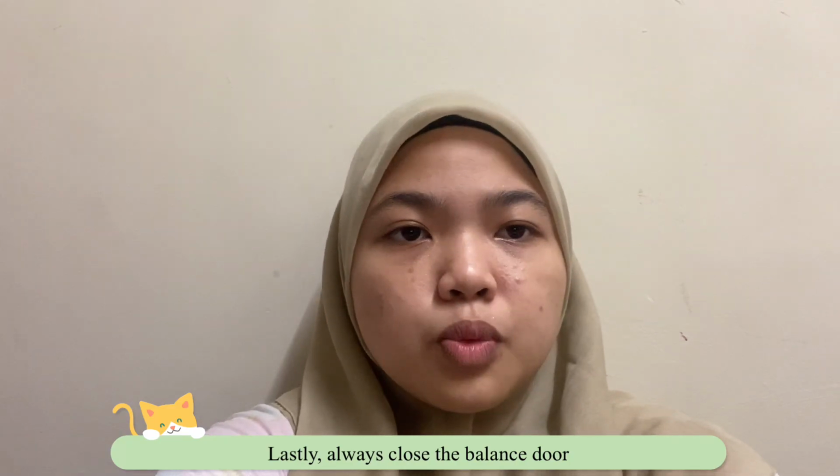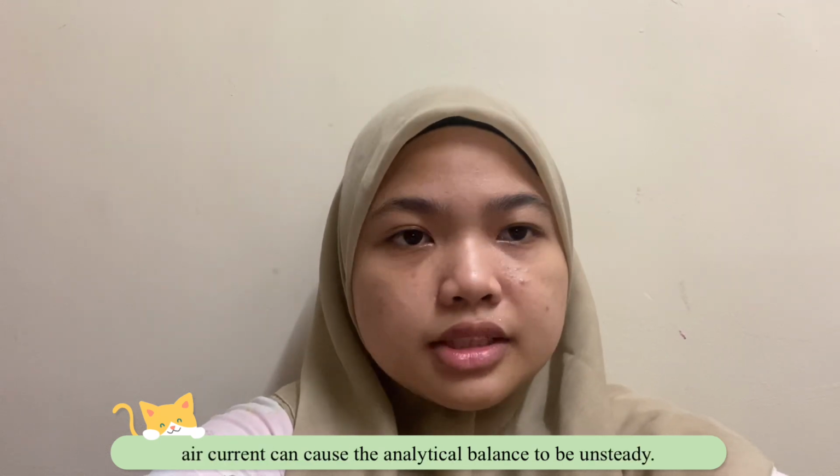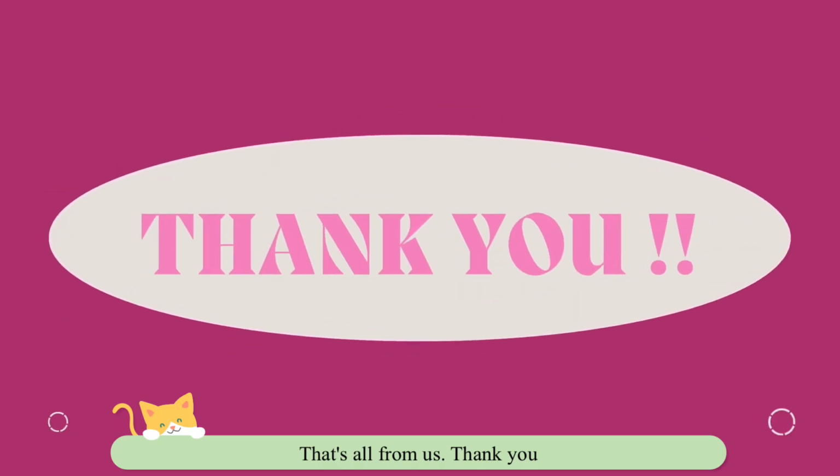Lastly, always close the balance door before making the weighing because air current can cause the analytical balance to be unsteady.